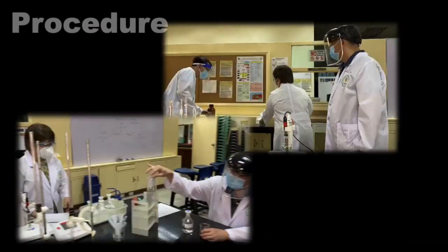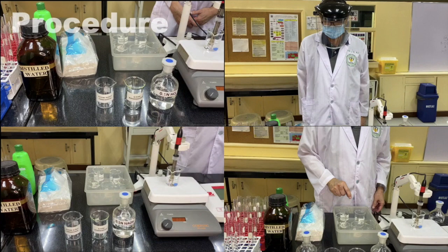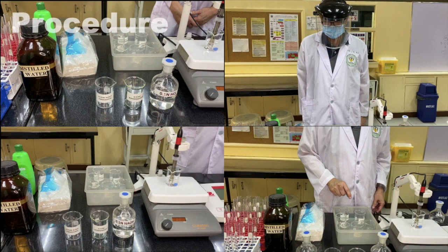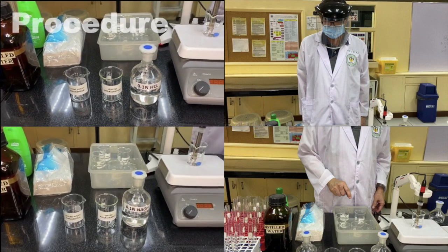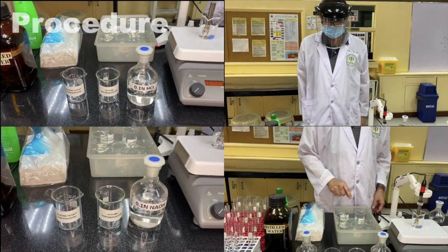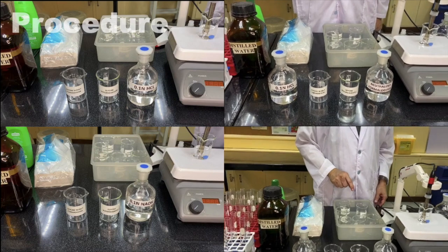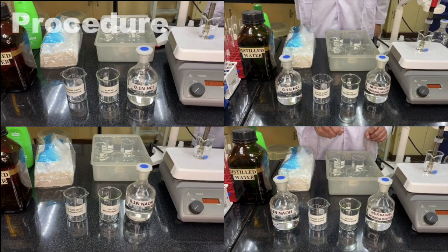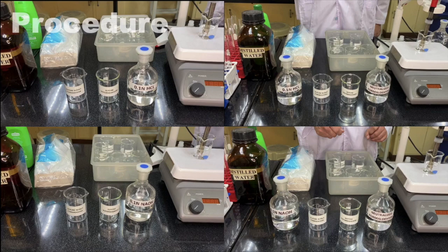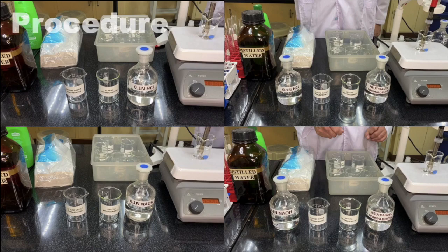Watch the procedure. For each amino acid, we will be preparing four 10 ml solutions. Each beaker will be used for the following steps: first, for the titration of the amino acid with hydrochloric acid; second, for the titration of the amino acid with sodium hydroxide; third, for the titration of the formaldehyde-treated amino acid against hydrochloric acid; and lastly, for the titration of the formaldehyde-treated amino acid with sodium hydroxide. Thus, for each representative amino acid, we will be doing four titrations. And with three representative amino acids, we will be conducting a total of 12 titration processes in all.